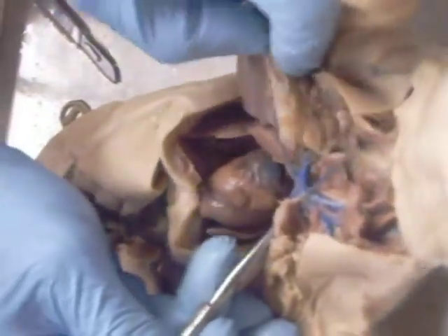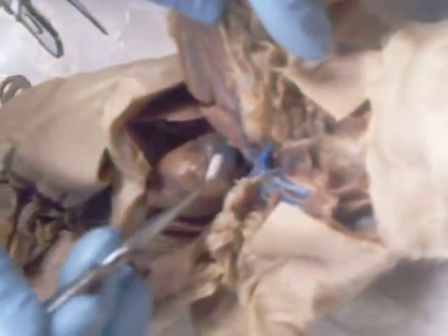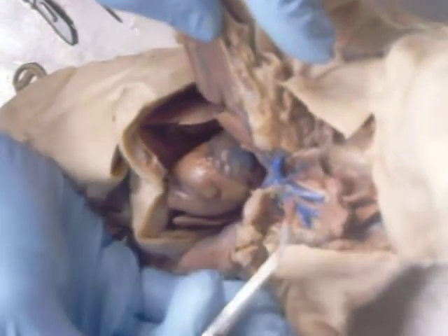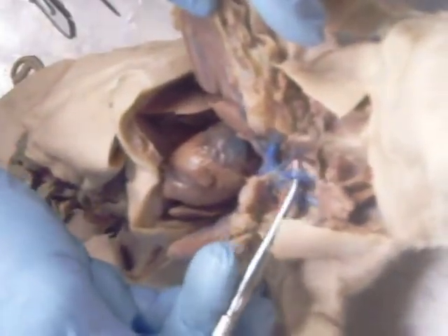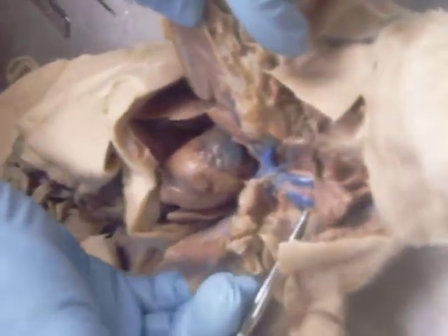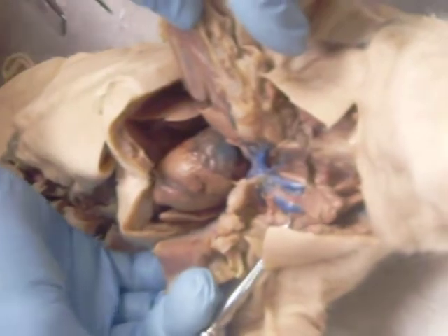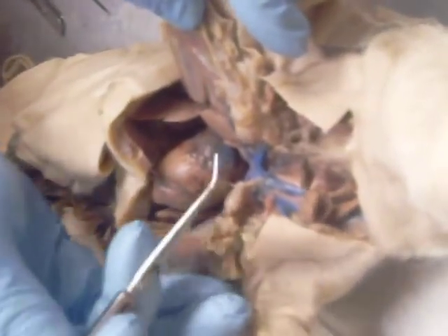Let's go over some things here. First of all, circulatory. What I would feel justified asking here. This is the anterior vena cava, right there. It branches, I'm doing the veins now, into internal jugular and external jugular. They're both right next to each other, internal, external.